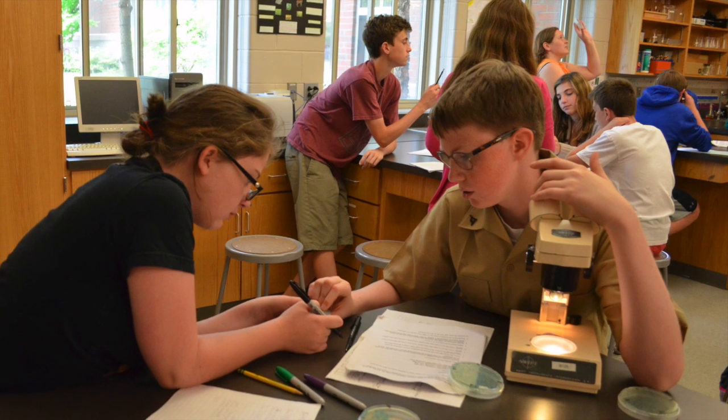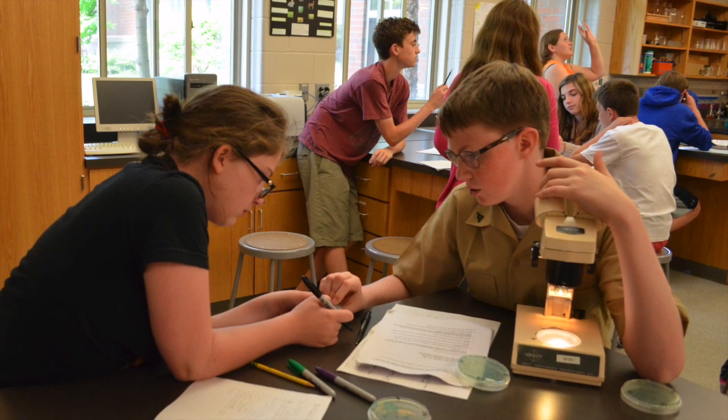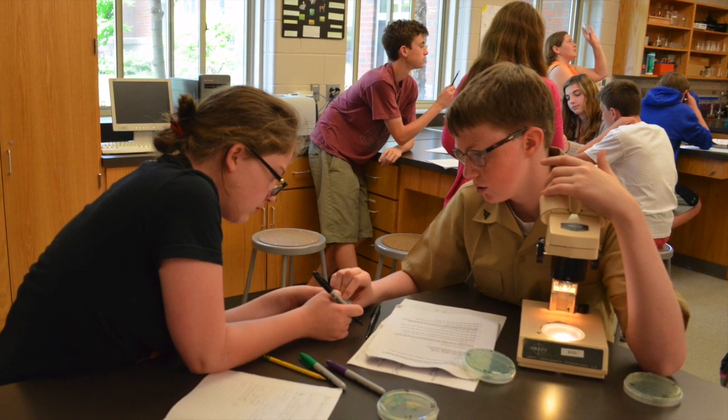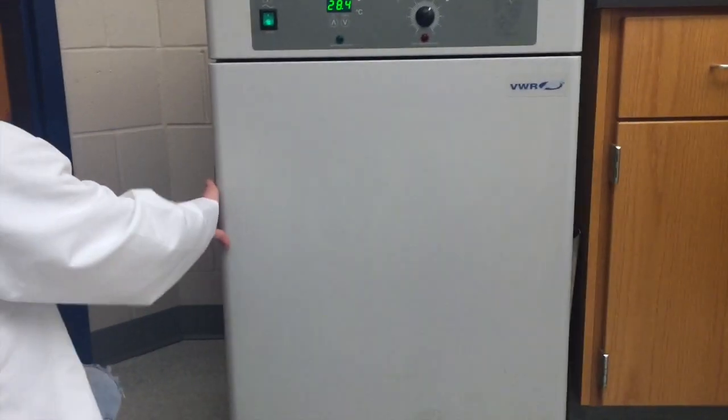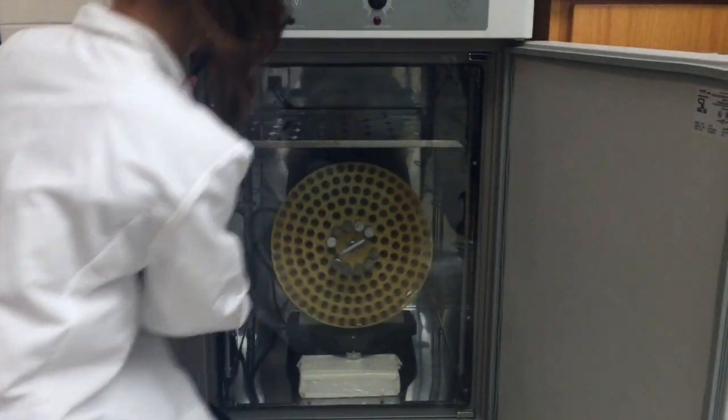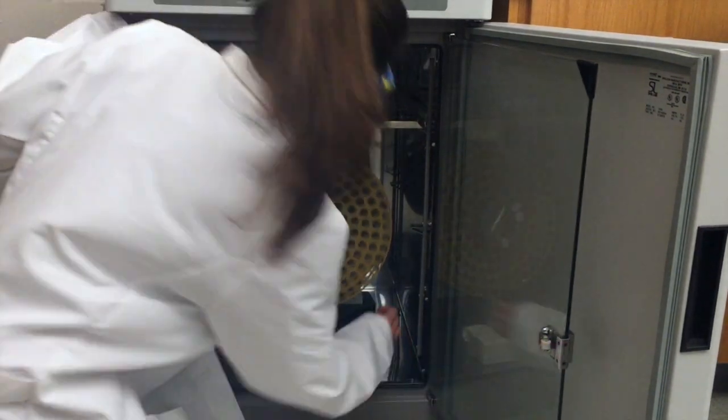There are a lot of steps involved in the process of a daily bead transfer, so it can be useful to have different students in your group complete different tasks. The evolution tube should be removed from the roller drum inside of the incubator following 24 hours of growth.